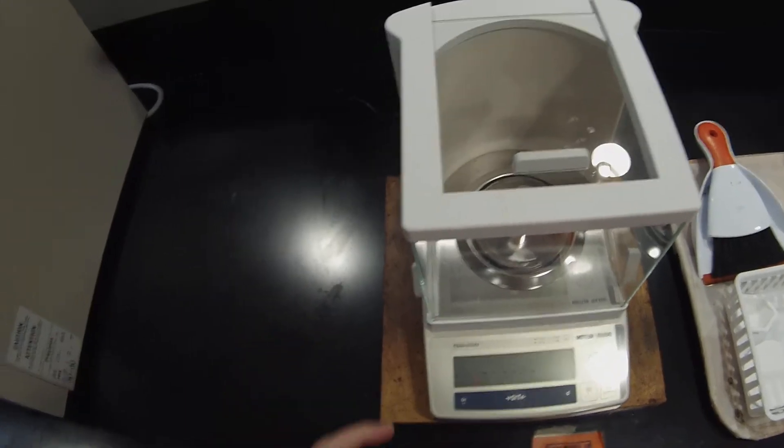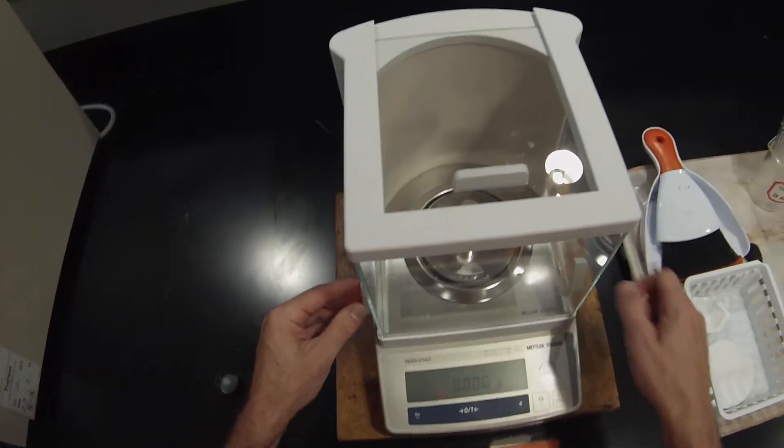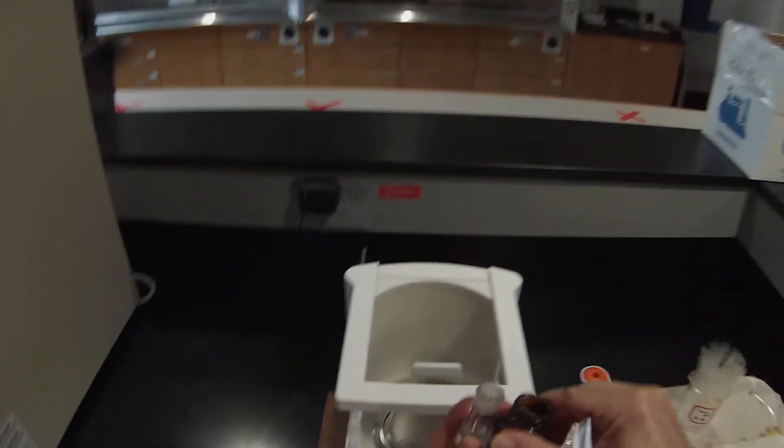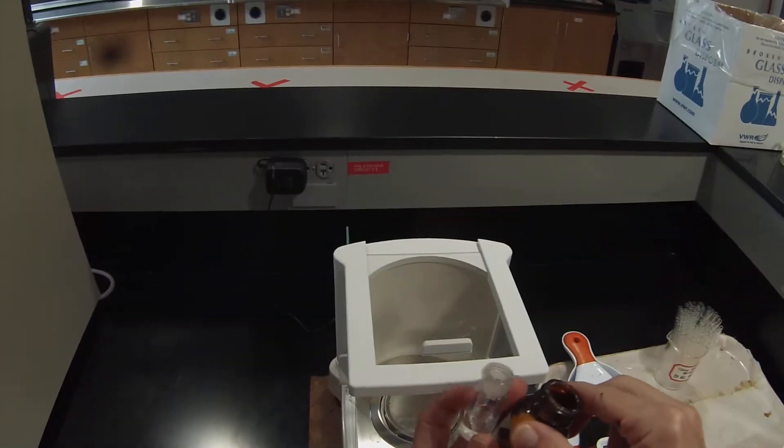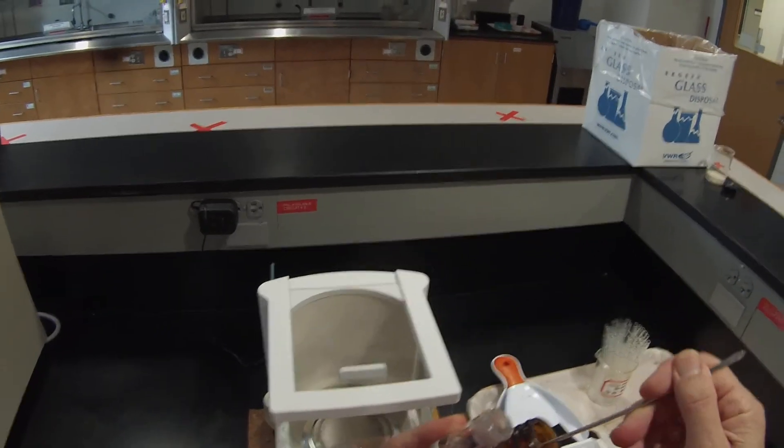This time I know that it's at about the 0.1 mark. So we tare the vial. So I can fill that up to about the 0.1 mark before I even worry about massing it again.